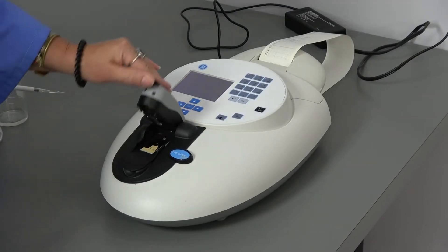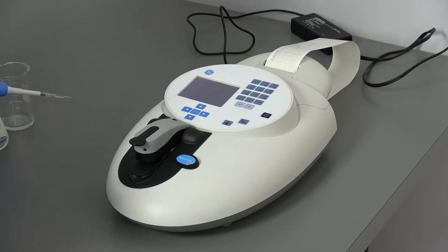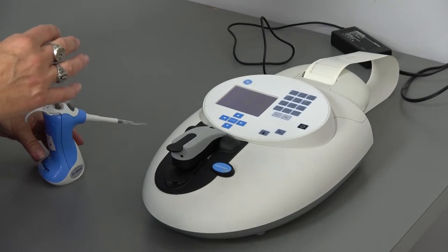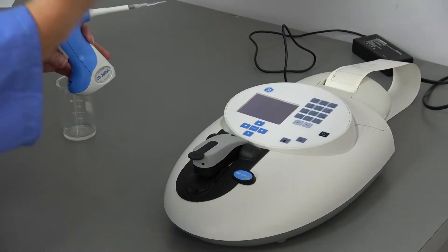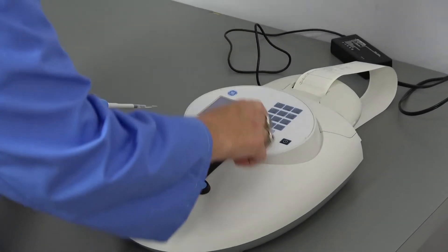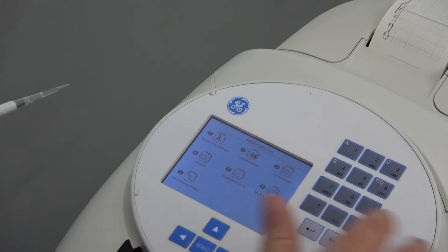The small area to sample eliminates the need for cuvettes or capillary tubes. We're going to go ahead and run it through a run with some distilled water just so you can get an idea for the functioning of the unit. We're going to use the WaveScan, which is one of the preloaded applications available on this unit.